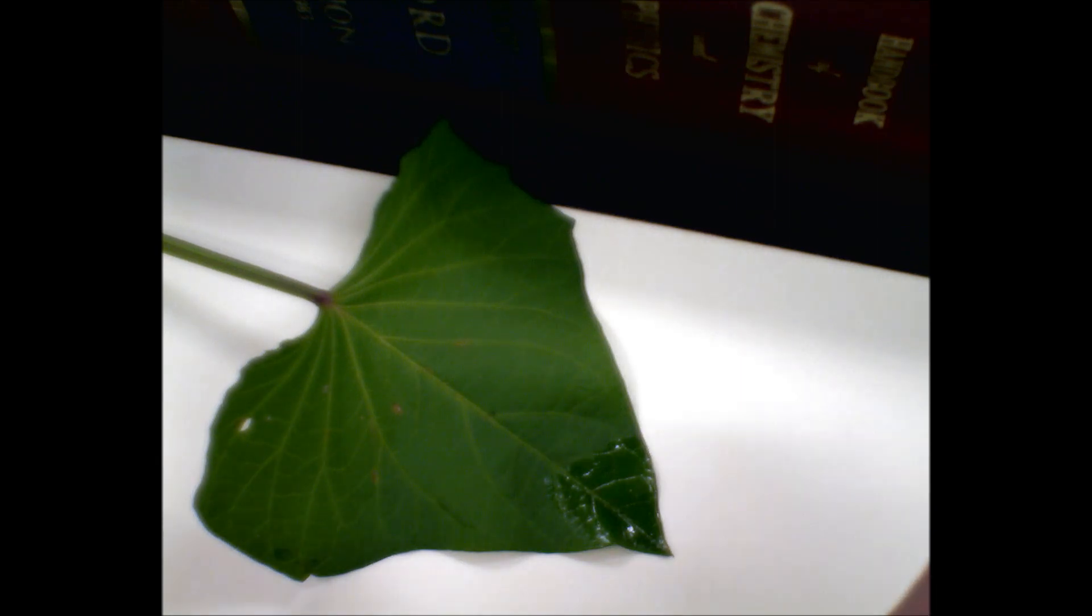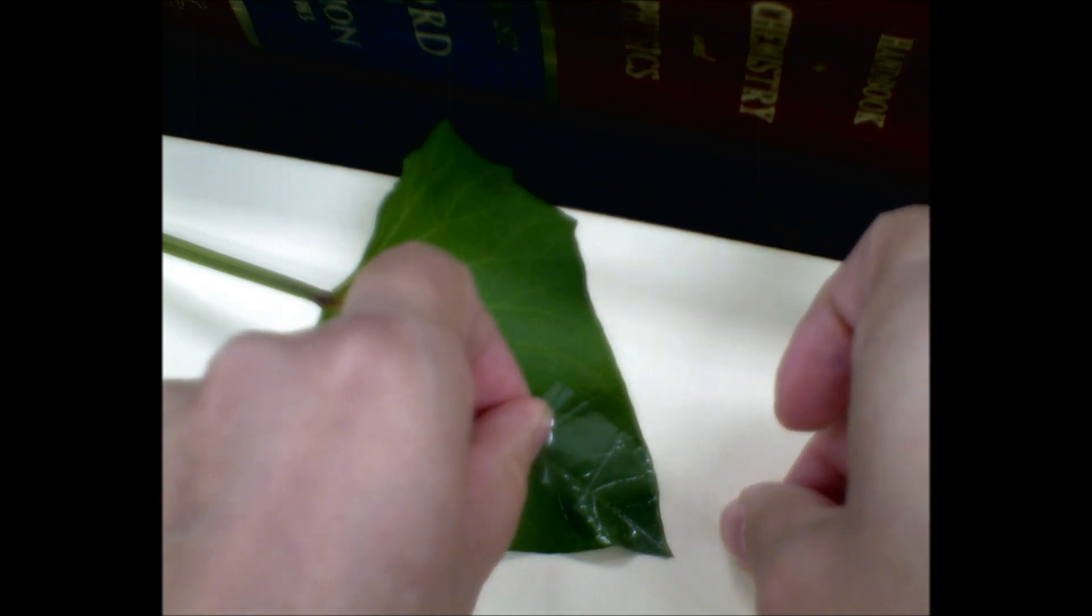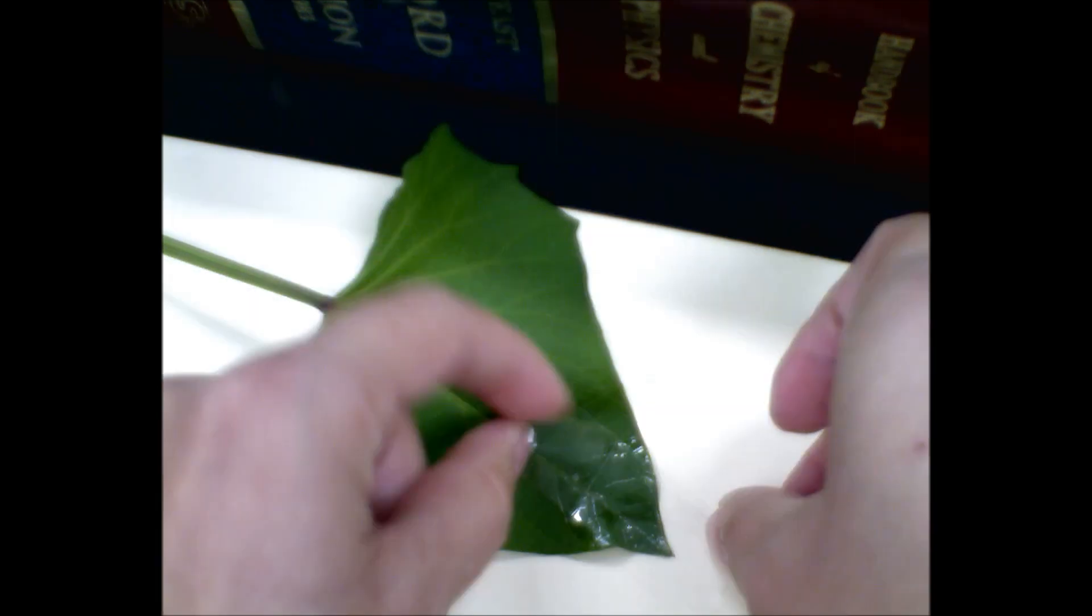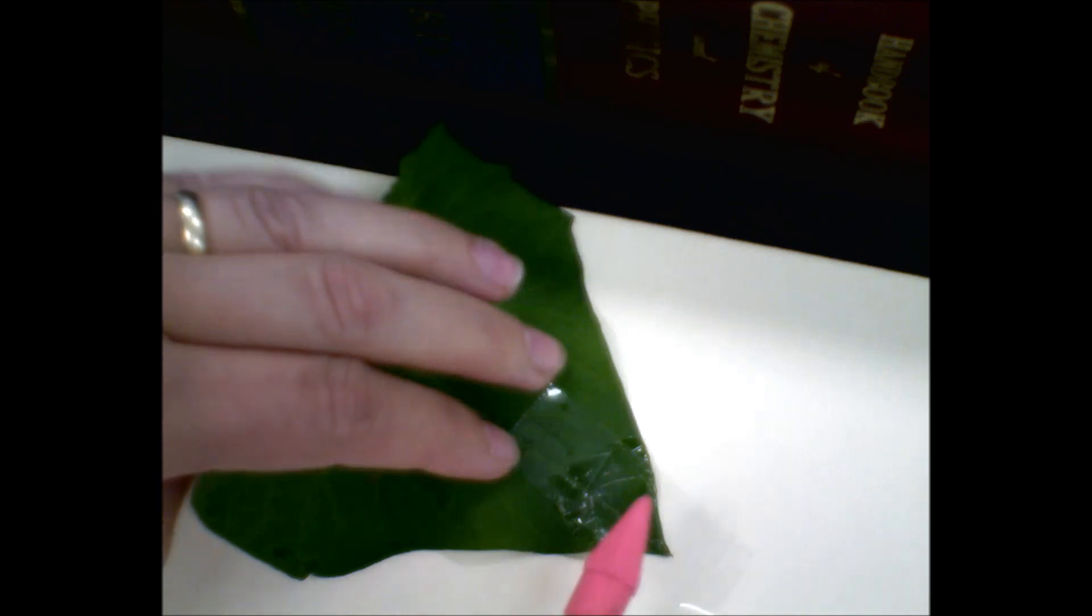So I just take the tape. Make sure you don't get your fingerprints all over it when you're doing this, because you want to see the surface or the cast from the leaves, not your fingerprints. So don't use your finger to smear all this down.